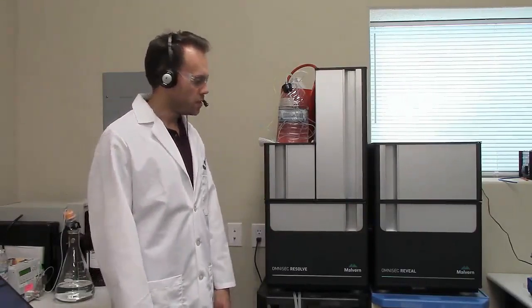Okay, the flow is up and running, and now we've got to let the system purge out for a few minutes. To get through the detectors, it's really only going to take a couple of minutes. For the viscometer, it's going to be a bit longer because the delay columns add about 10 minutes to the runtime, and they must fill up with water and they must entirely flush out as well.